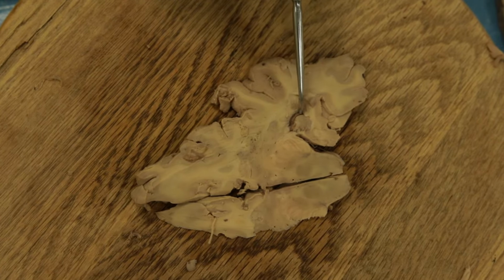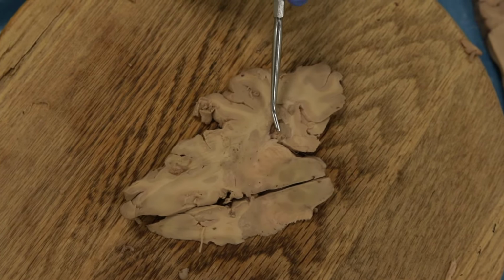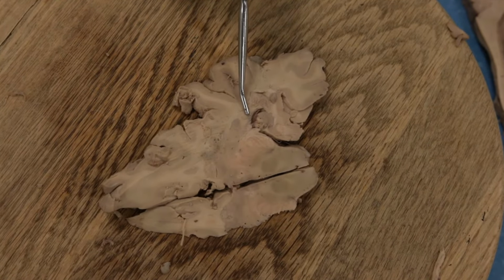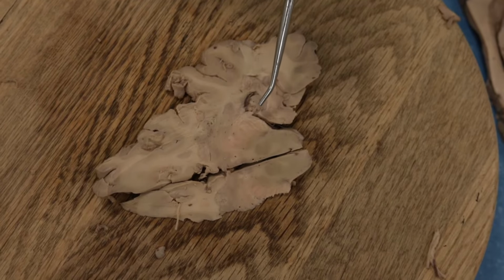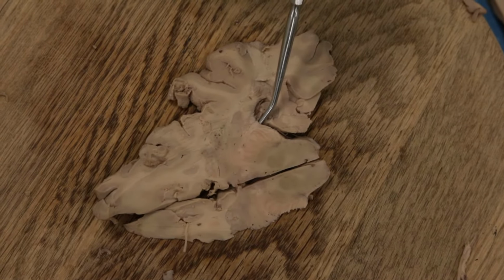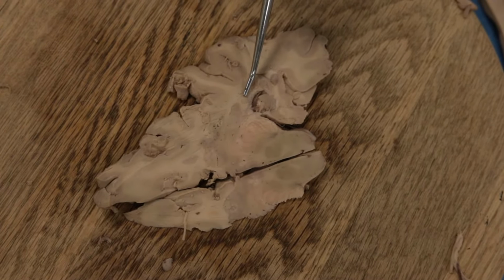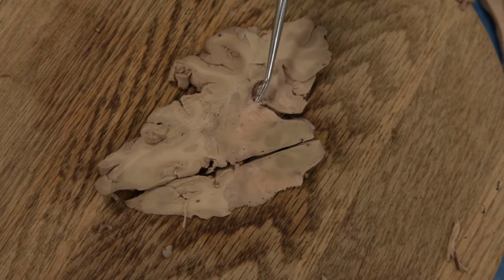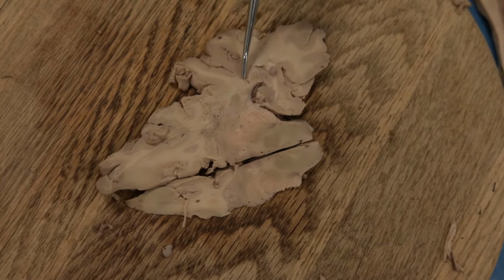All right, if we move out laterally, again we have the temporal horn of the lateral ventricle with choroid plexus. Kind of on the floor of that, we have the hippocampus curling up here. And above the temporal horn of the lateral ventricle, we have the tail of the caudate. Now I think what we're seeing here is just a little bit of the optic tract. The lateral geniculate nucleus is out in this location, but this does not have the classic Napoleon's hat, so that's not a great example of a lateral geniculate. But this is the optic tract here, which provides vision to the lateral geniculate, and then the optic radiations fan out from there.